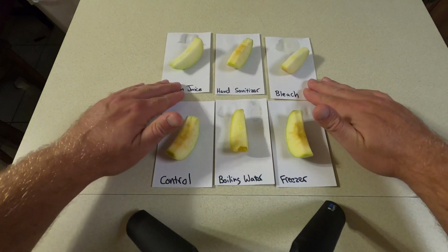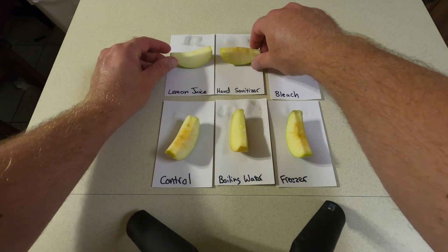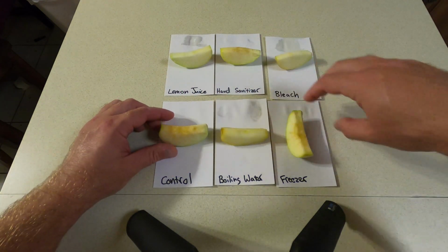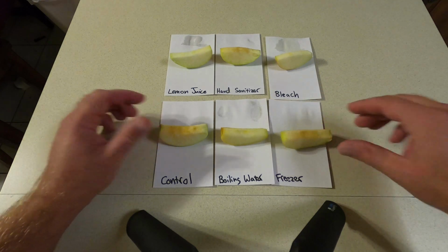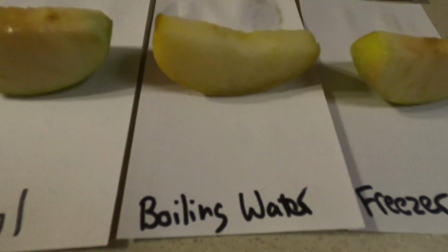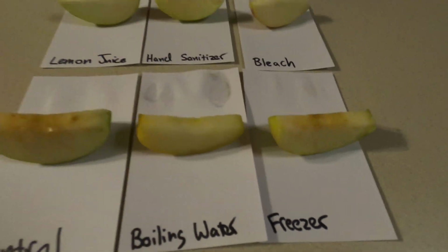So right there, you should be able to draw a conclusion looking at these again. Let me turn them to the side. Sometimes different angles can help see things. Let me get my camera here, adjust it for you. Alright, right there, let's look at the control again. Look at that. Compared to the lemon juice. Hand sanitizer. Bleach. Control again. Boiling water. And freezer.